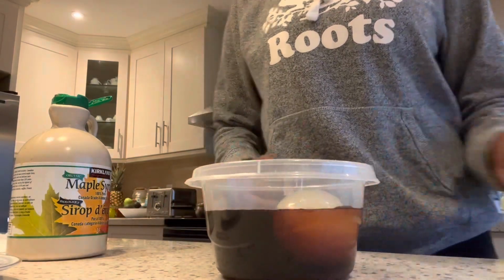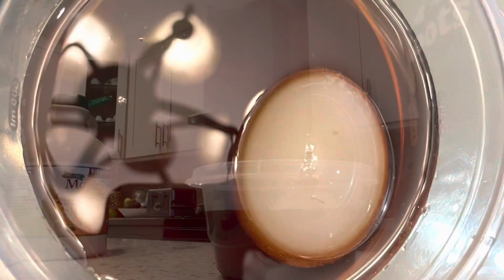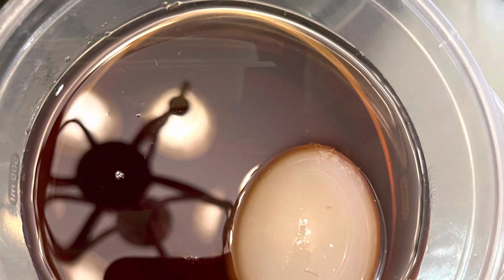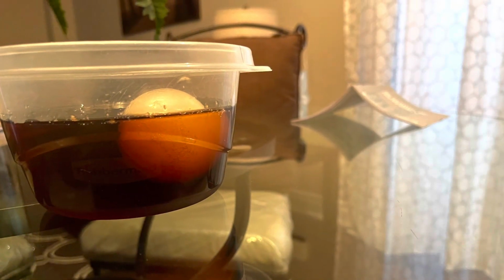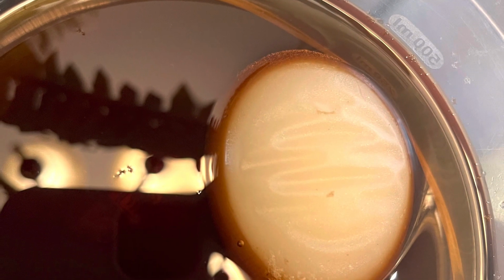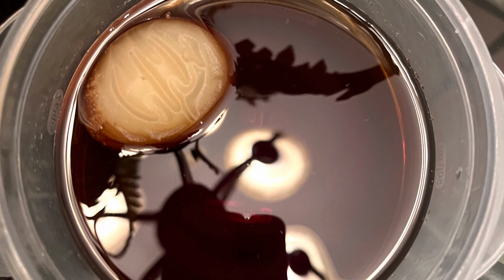Over time, Egna became shriveled and wrinkly. At this point in the experiment, Egna was sitting in a hypertonic solution. This meant that there was a higher concentration of solvent in my egg cell. The syrup is so sweet and sugary because it has a high concentration of solute. In a hypertonic solution, water moves out of the cell due to a higher solvent concentration in the cell. This left Egna with a flaccid shape because there was no solvent to keep the cells in shape.